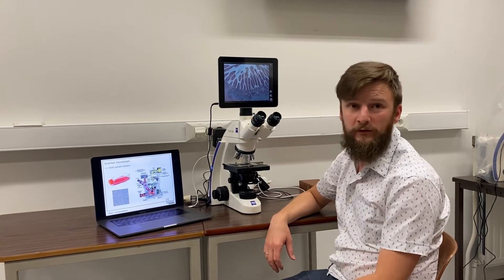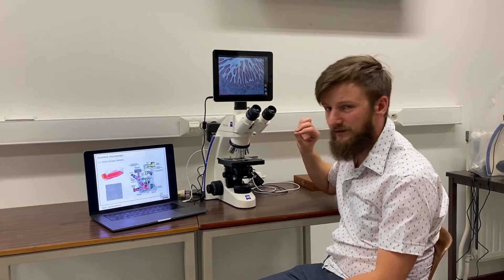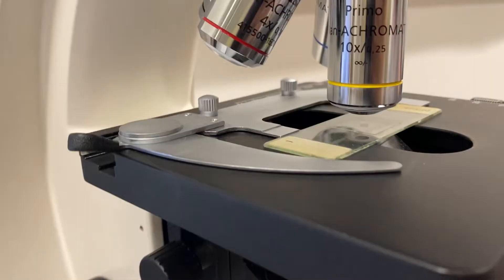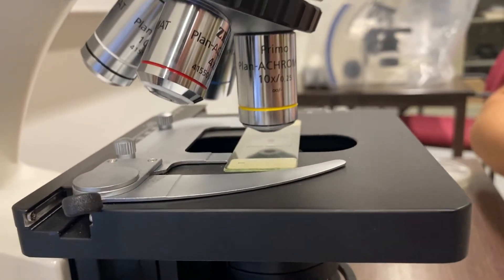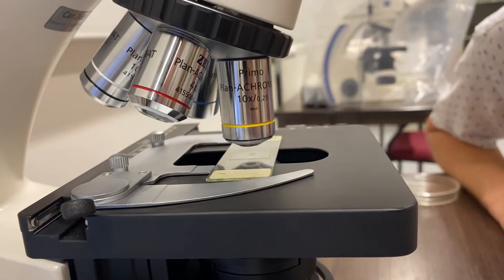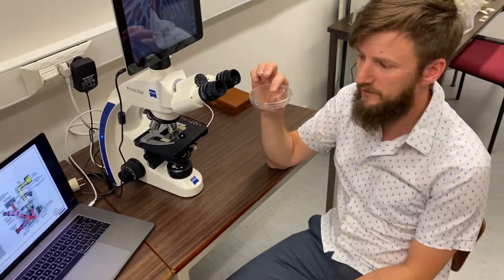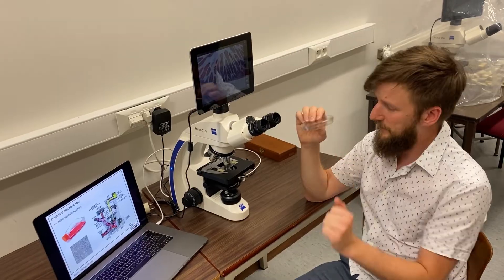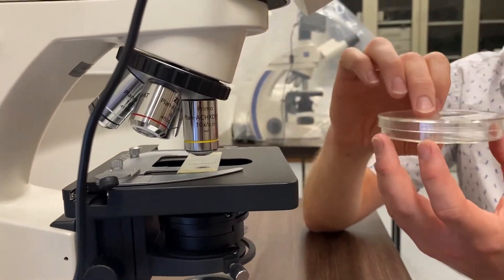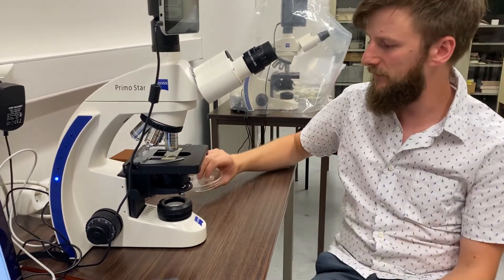This is a standard laboratory microscope, and you can only use it to image very thin samples. As you can see, the distance between the objective lens and the sample is quite small. These high-quality objective lenses typically present on laboratory microscopes have a working distance of less than a centimeter. So if you have a sample mounted in a petri dish or culture flask, this becomes problematic — you cannot image it on a standard laboratory microscope. You might remove the lid, which is possible for some samples, but for others the lid must remain closed, so you need a different geometry.